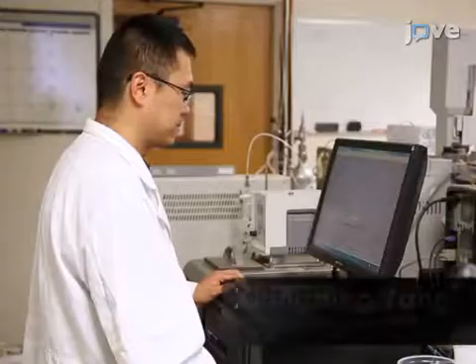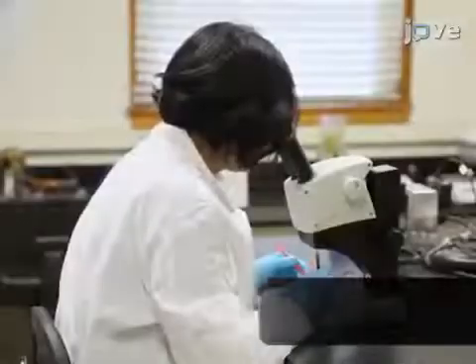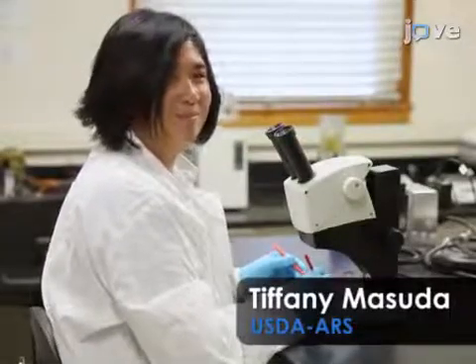Demonstrating the procedures will be Dr. Xiangbing Yang, who is a post-doc in my lab, and also Tiffany Masuda, who is a technician in my lab.